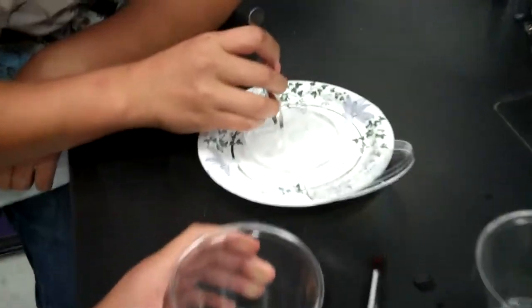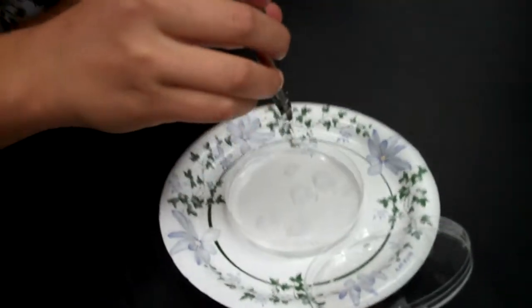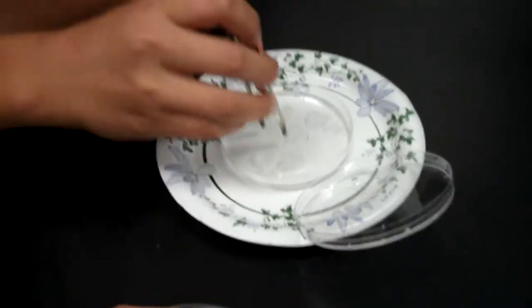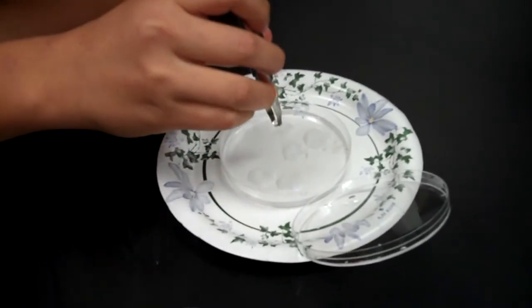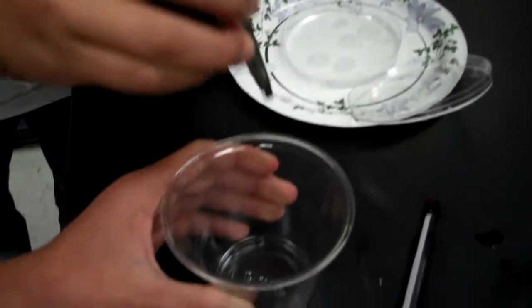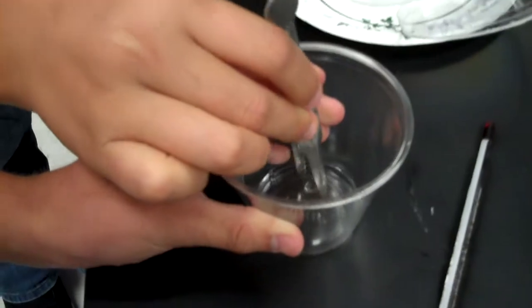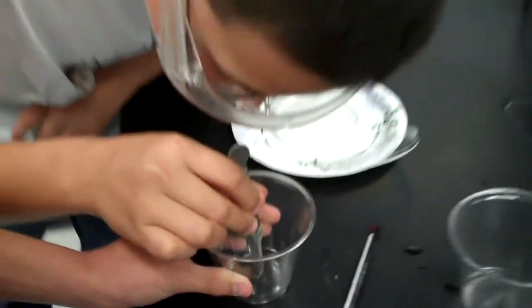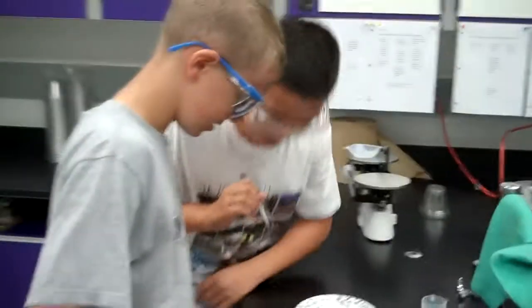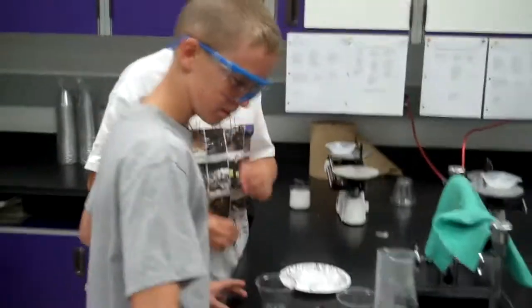Okay, so here we are selecting our Seed Crystal. Yeah. Oh, let's try that again. It's a beauty. And we're placing it right in the center. Perfect. Okay, good job, gentlemen. And we'll find out tomorrow if you've got a winner.